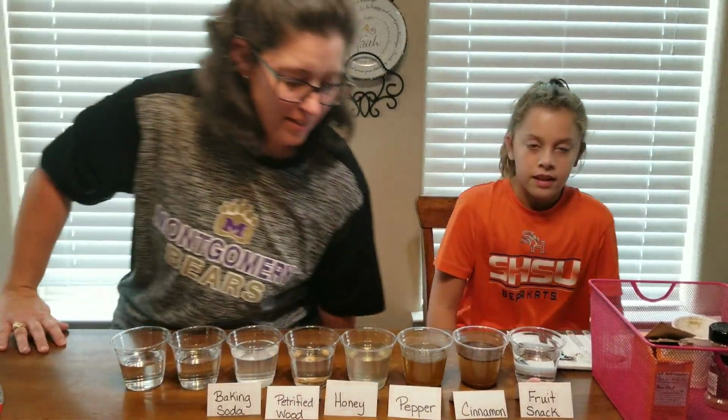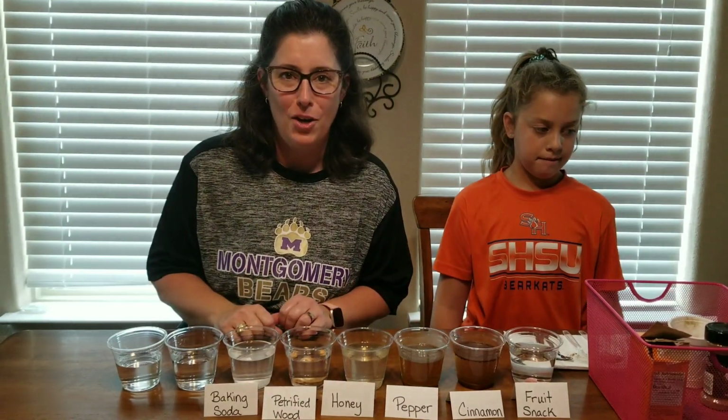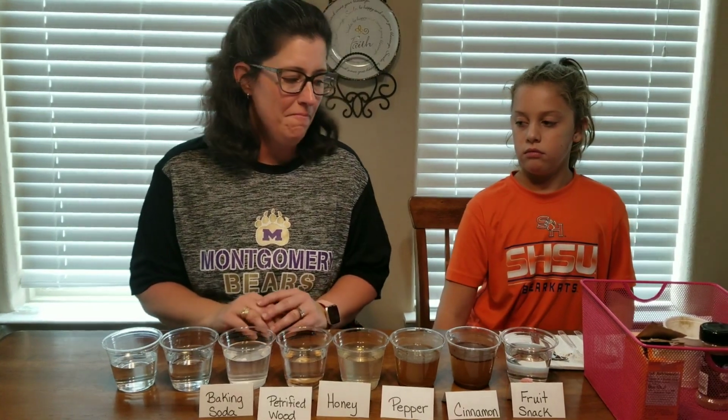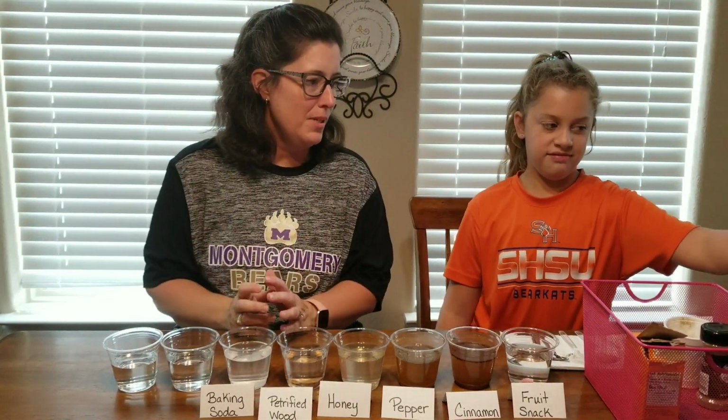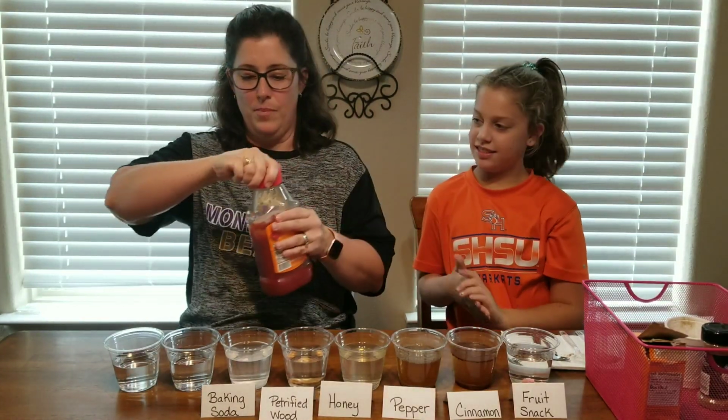Okay, friends, we discovered after we videoed the lab that we had part of the lab cut off just as we were doing our last 2 mystery substances. So we're going to try those again. So next mystery substance is ketchup.